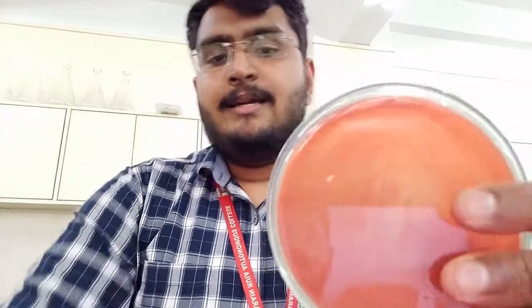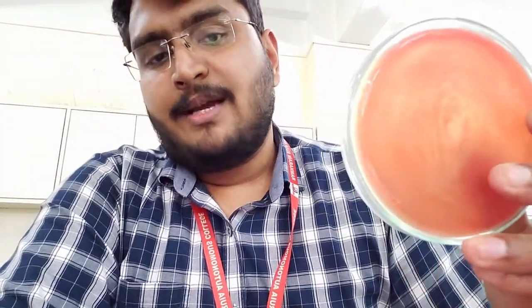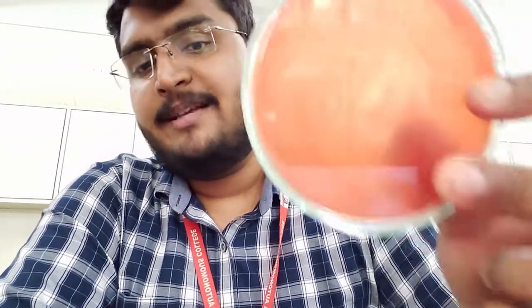In this video we will discuss studying hemolysin, a virulence factor which is also an enzyme. Hemolysin is normally detected on blood agar. Superimposed blood agar is used in this experiment — it is blood added to nutrient agar after autoclaving and then mixed well.